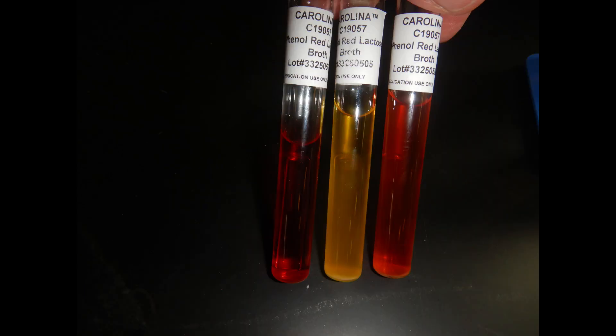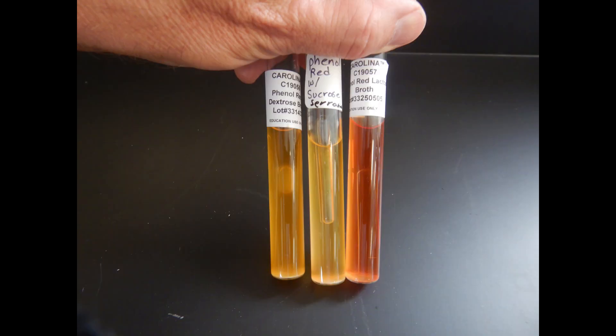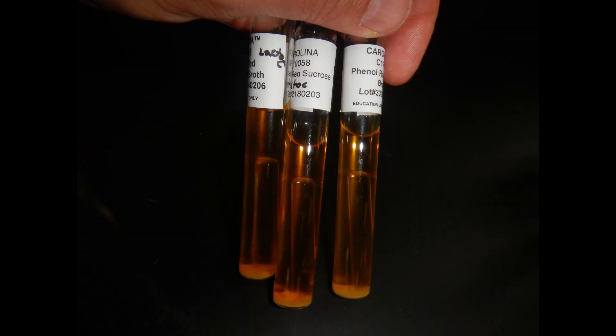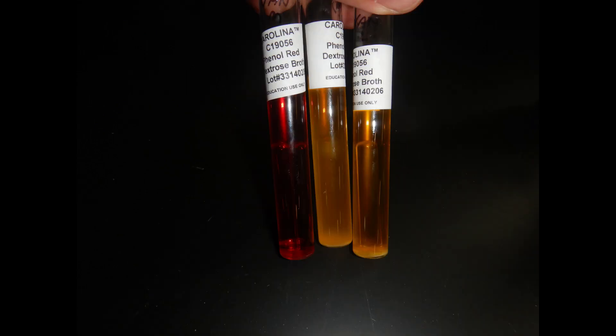Other bacteria may be able to metabolize some of the sugars but not others. So if you were trying to distinguish between different types of bacteria, you could consider the results of these carbohydrate fermentation tests to help you distinguish between them.